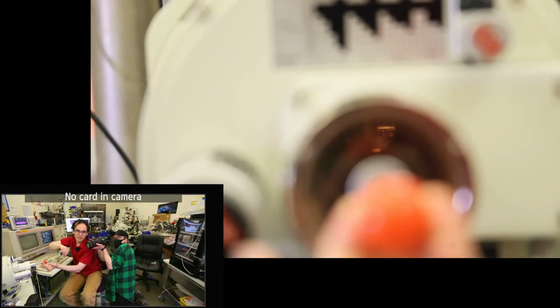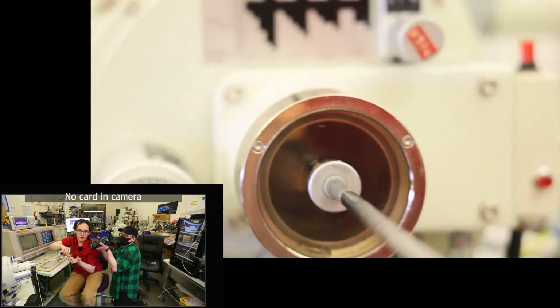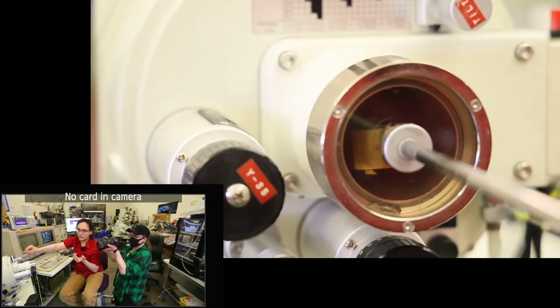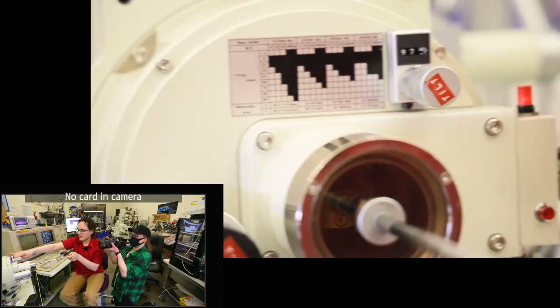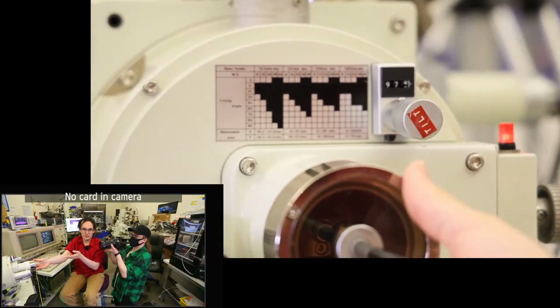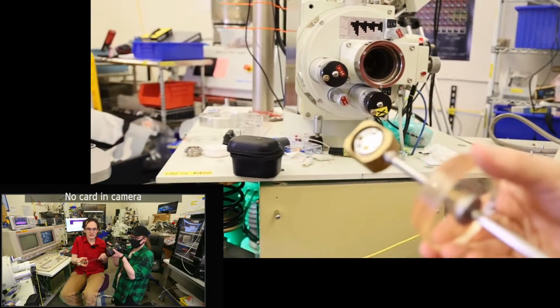Okay, so we've got that threaded in, so now we can pull it out. And we have retrieved our sample holder into our load lock. So we'll go ahead and close our airlock and press the button again. That's going to vent it, so I'm ready to catch it. And there we go. That's the sample we had in it.